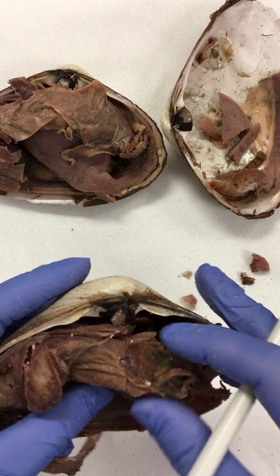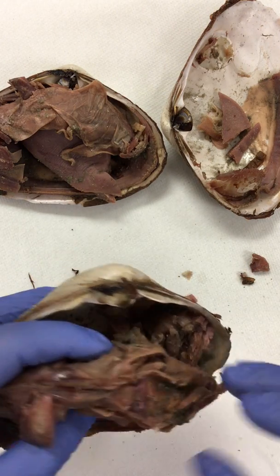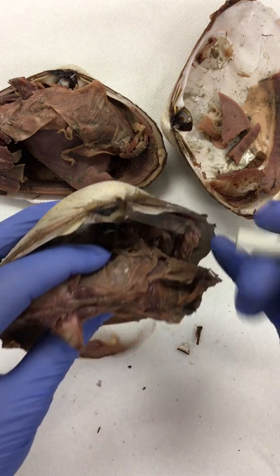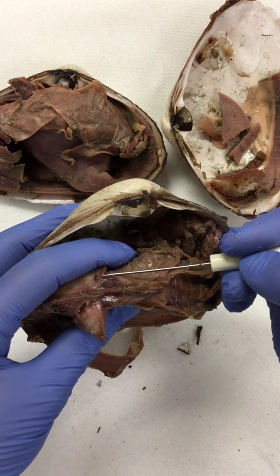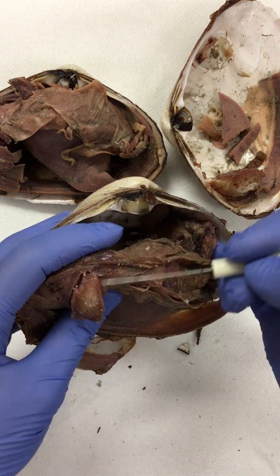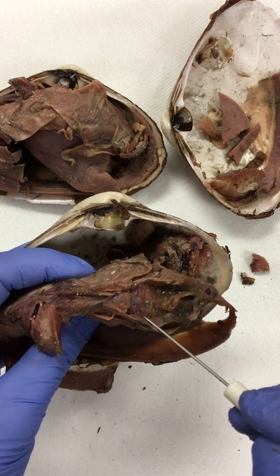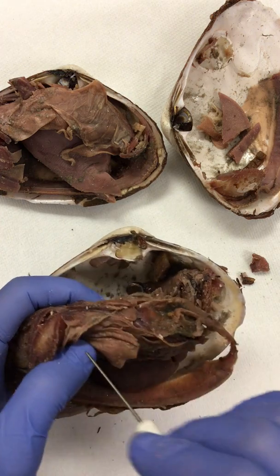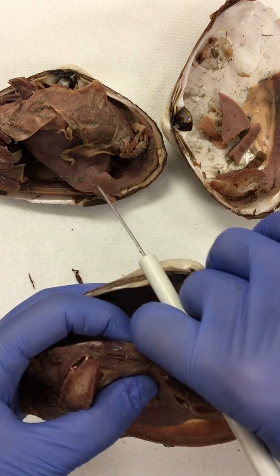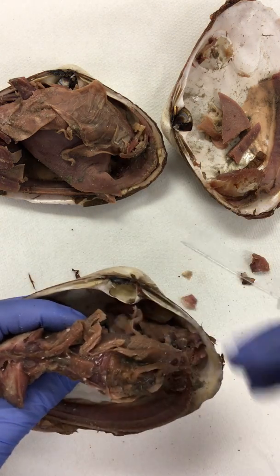We mentioned earlier that there were some muscles. There are some other muscles here, and you can see these muscles. Notice how they're a darker color here and here. These are part of the retractor muscles. So we have the adductor muscles and these smaller retractor muscles. The intestine, again, is going to lead up in this direction, and what we can do is pull back some of this tissue and unveil the heart. This region right here contains the heart.